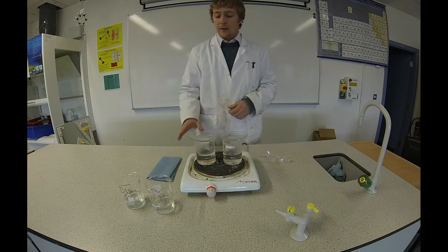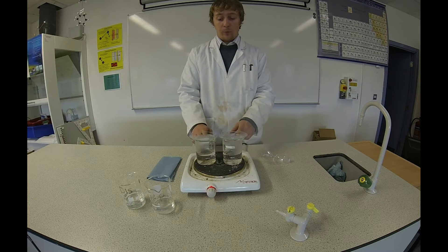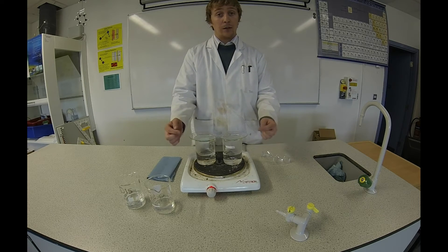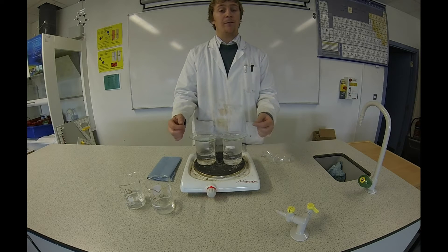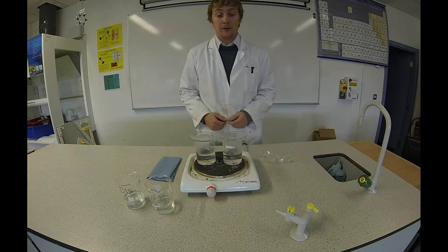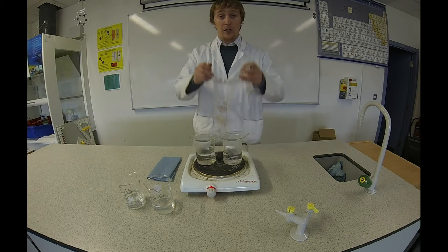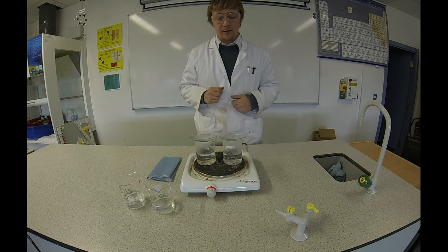You need a hot plate with two beakers with boiling water in them. You need clock glasses on top — that's where we're going to evaporate our water and be left with our dissolved substances. And as always guys, you need your goggles on because you need your eyes to see the results.